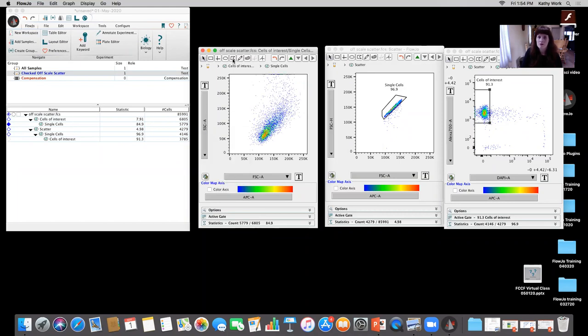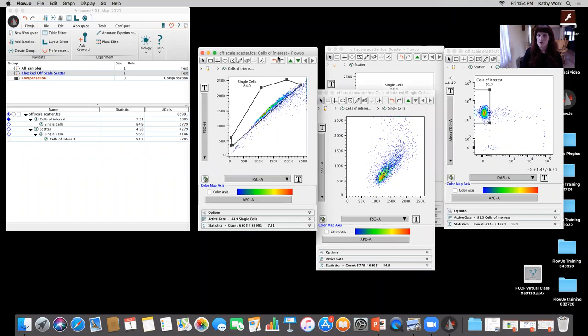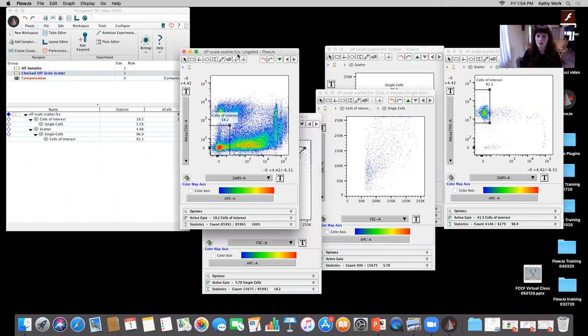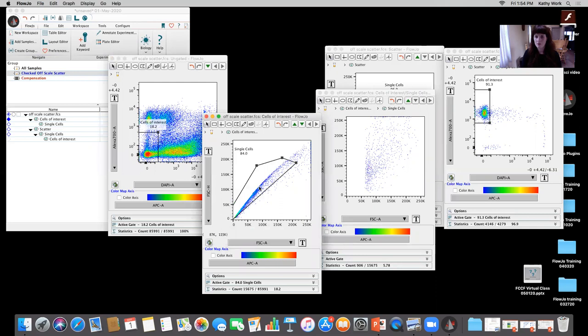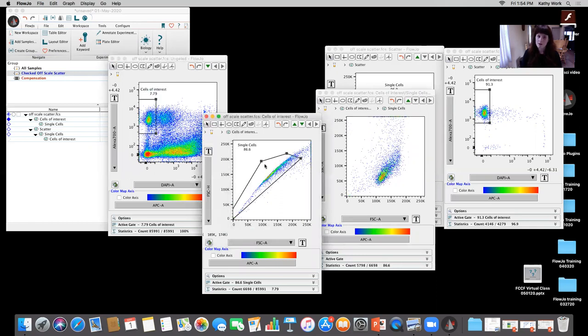Okay, so then here's an example where maybe I'm not gonna use a scatter gate to exclude debris. Because I looked at my marker of interest versus DAPI, and I pulled that out, I was able to exclude most of the crud and stuff I wasn't looking at. Now, if I come down here, that debris was all kind of right down there, right? This isn't always the case where it pulls out so nice.